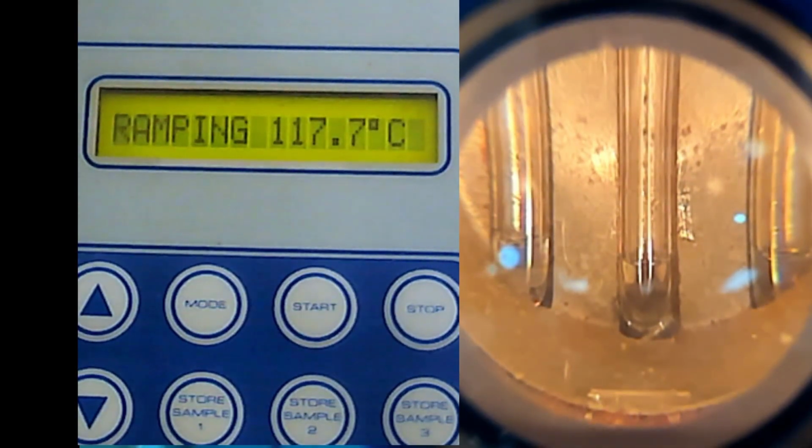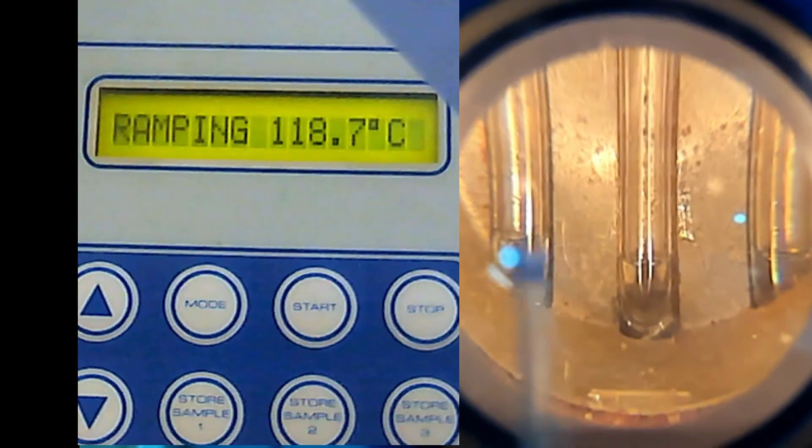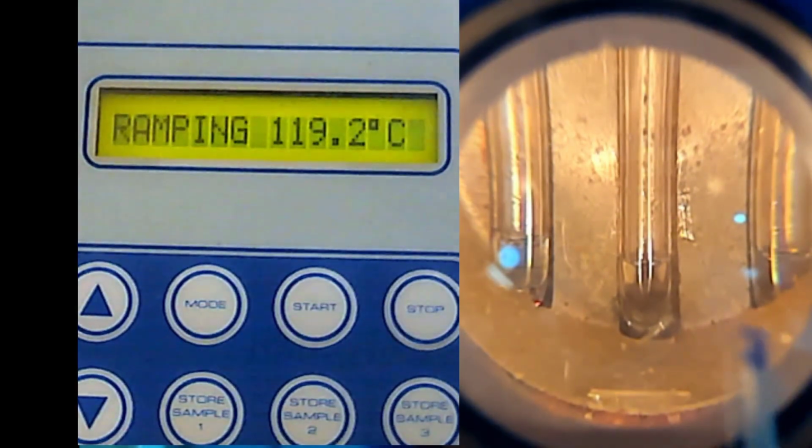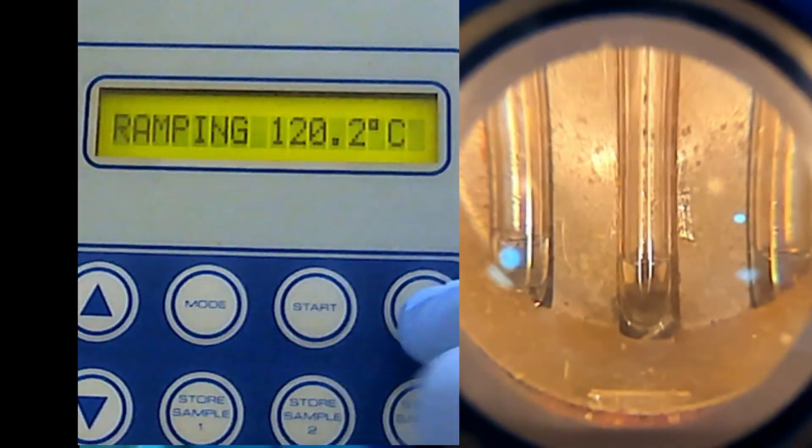You need to jot down and give your answer in your lab report. Not only that, you need to tell me the possible mixture of each of these. Later on when I give you a video, you can take a picture of this part, and then tell me what this is, what this is, and the possible mixture for each. And then we stop.